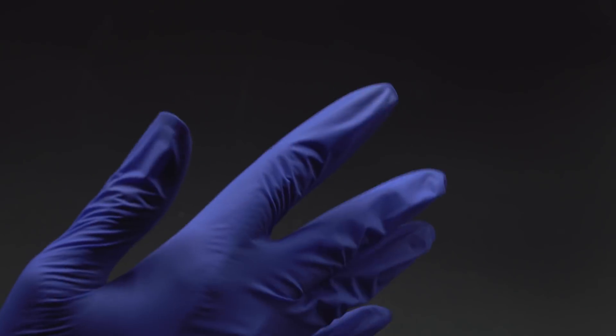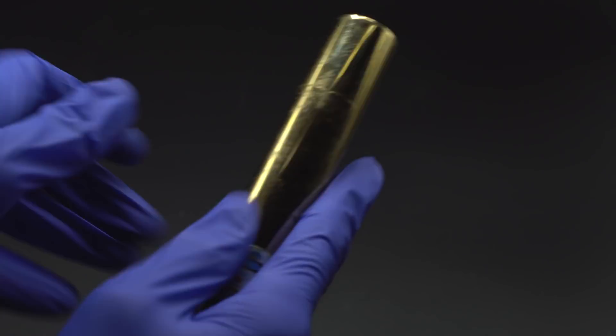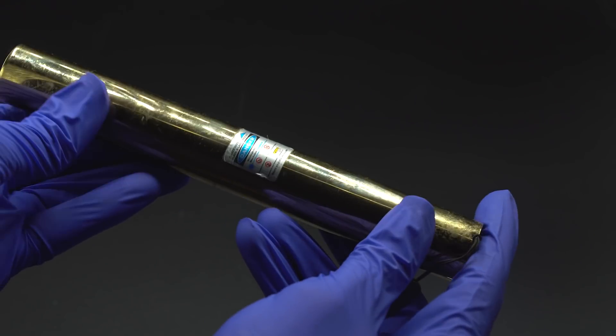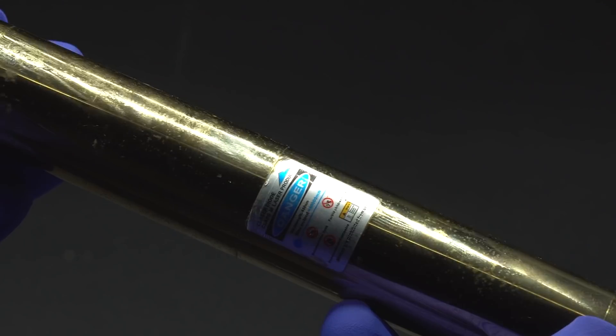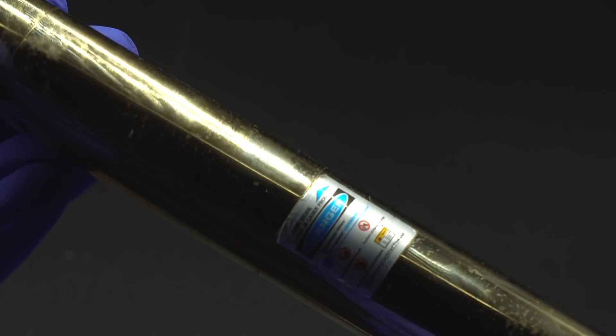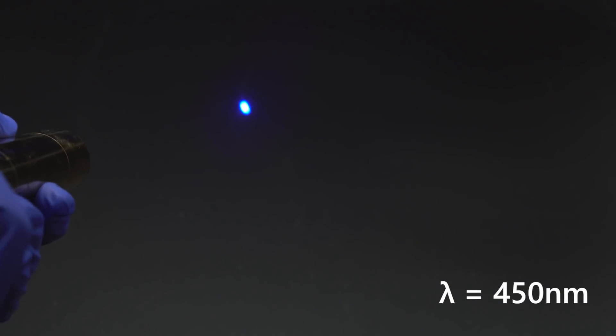Hey guys! Today I chose yet another visually attractive chemical reaction for you that occurs under the influence of light, that in this case will be represented by a blue laser beam with a wavelength of 450 nm.